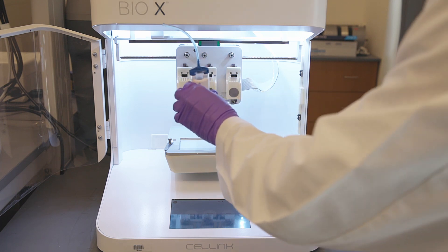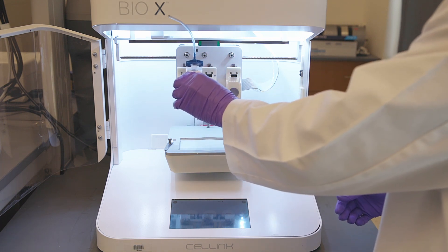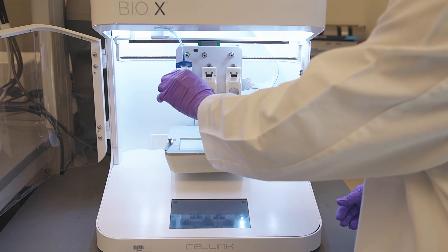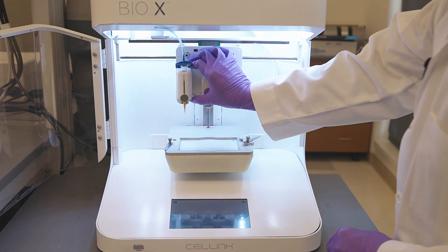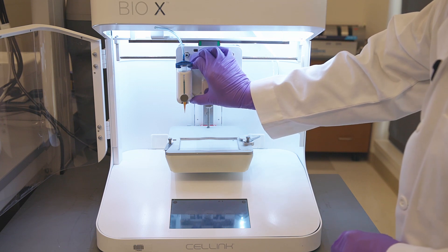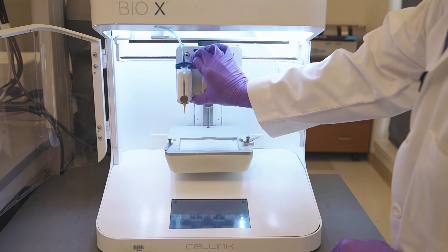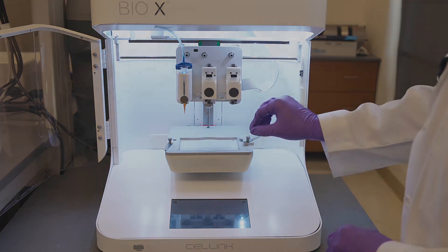Move this assembly onto the printhead position number one. As we can see, there is no light glowing now, which indicates that the printhead has not been seated properly. Gently press down to see the light. Once it turns blue, the printhead is in the correct place.